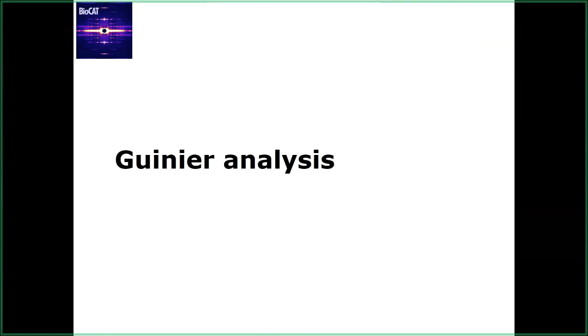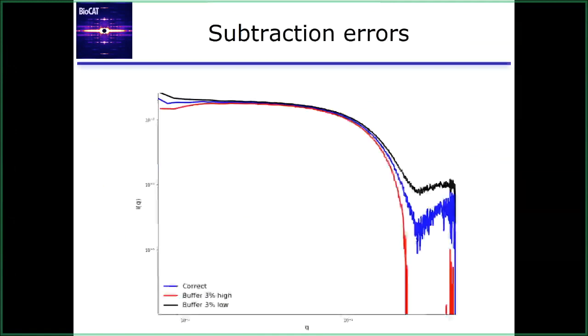The question is, what will be low buffer subtraction? Well, I have to revisit this. I'm not sure, there are two ways to interpret that. One is that low buffer looks like this black curve. It doesn't subtract off enough of the signal. What I think they might be getting at is, when does it happen? The answer would be, for example, suppose you make up a matched buffer by hand, and the matched buffer you run for the subtraction doesn't quite have enough salt in it. It's going to have a little bit less scattering than the buffer you measured your protein in. And so when you subtract it off, it's not going to subtract out all the scattering from the salts, and you end up with this offset on your scattering profile.